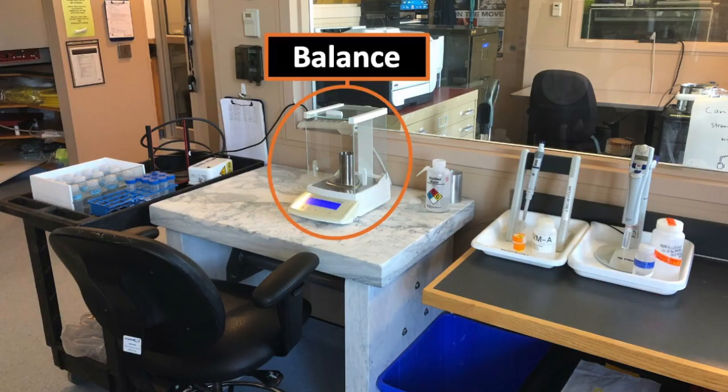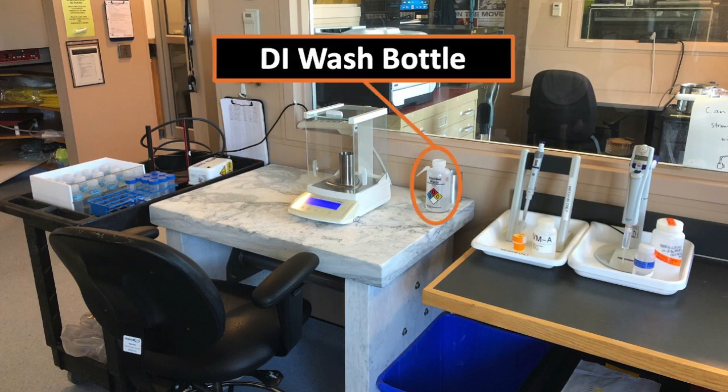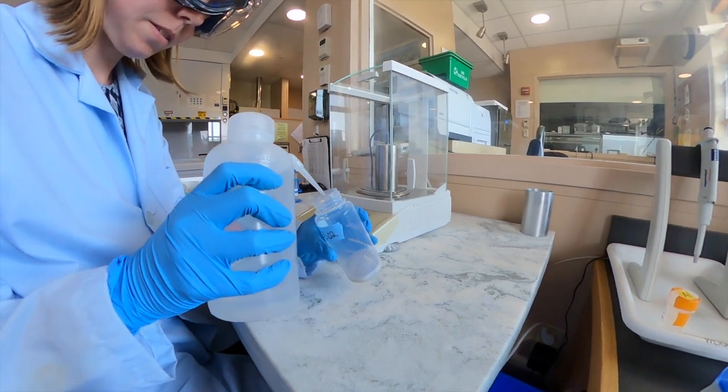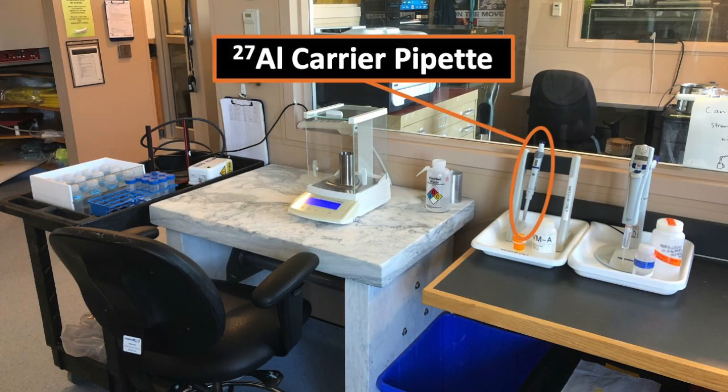We have a balance that reads out to 4 places. The purpose of this is so we know exactly how much quartz we have added to each sample. We have a marble balance table, happens to come from Proctor, Vermont, weighs about 1,000 pounds, and that helps reduce any vibration so that we can get a good measurement on the balance. We have a DI wash bottle that we use to wash down the sides of our bottle and to dampen the quartz. We have several carrier pipettes.